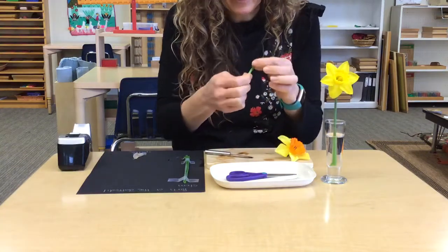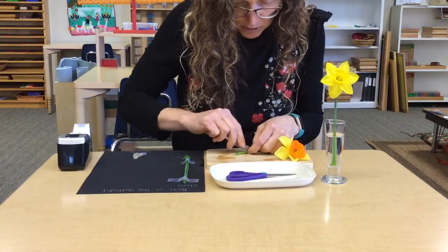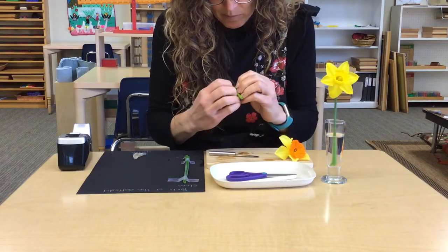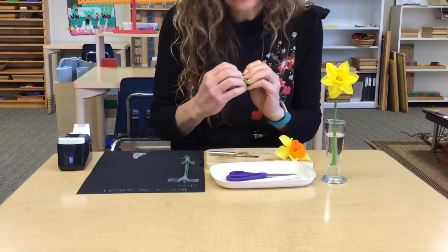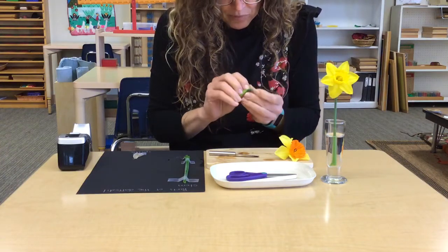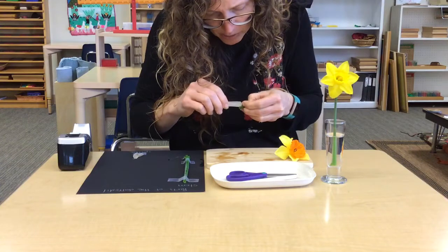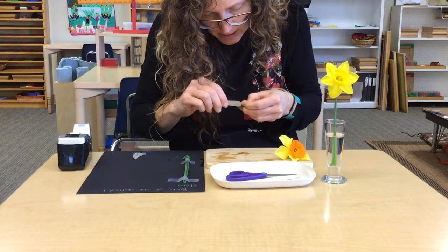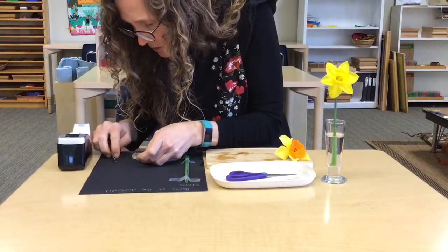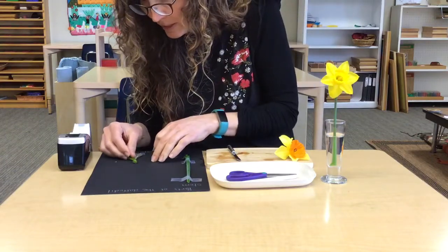So you can remove the ovary and then carefully with your knife slice it open, and inside you will find some very tiny little spherical objects that are the seeds of the daffodil. So what I'm going to do is use my knife tip to carefully scrape a few of those seeds out. It's not that easy because it's so slippery. And I'm going to put some seeds down here on my chart. You probably can't see those from there. And then I'm going to put the ovary here too.